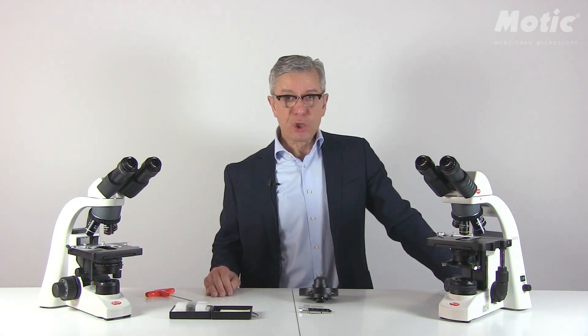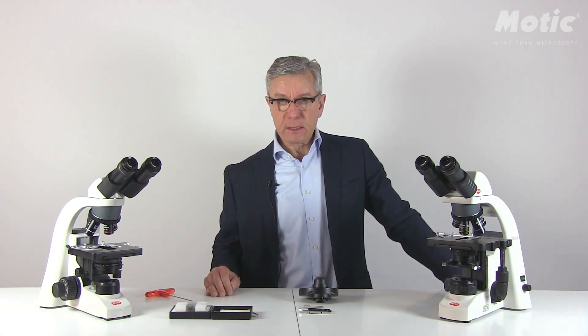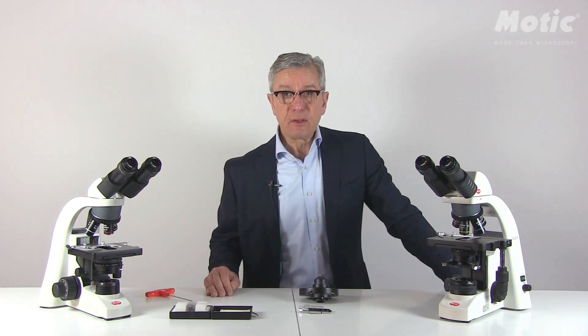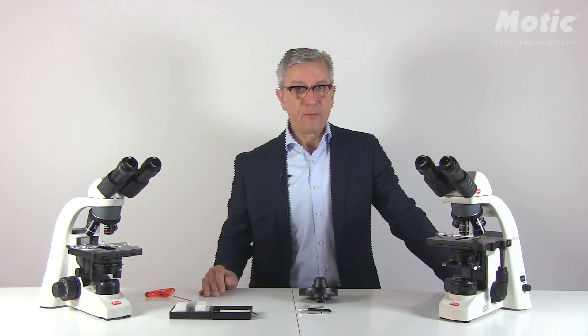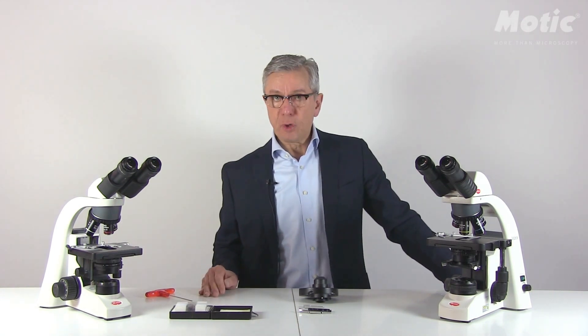Hello again, this is Hans-Jörg Klemens from company Motic speaking. Today I'd like to show you some details about our darkfield solutions in our series of BA microscopes of upright transmitted light microscopes — BA210, 310 and 410, respectively the elite versions of those models.